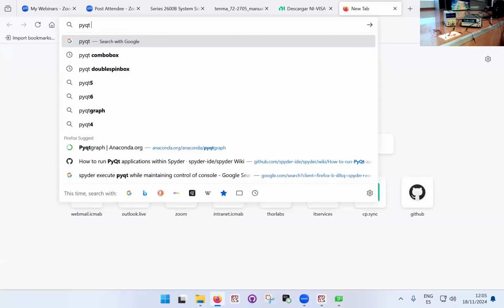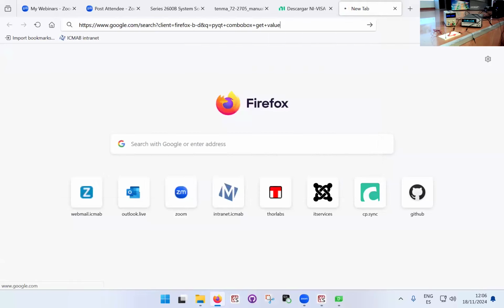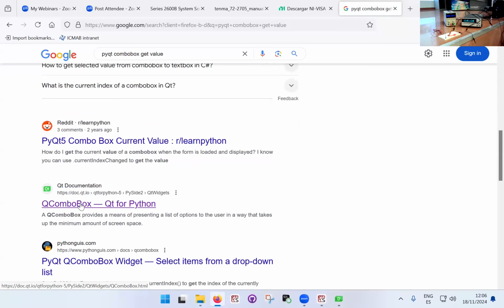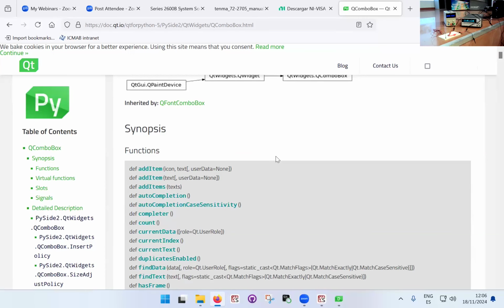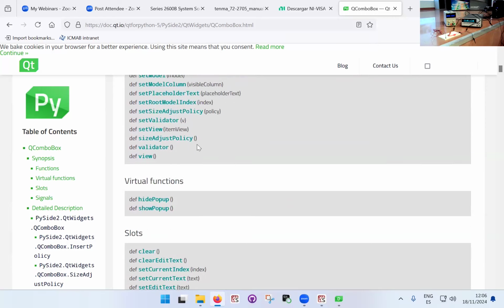I'm going to go for PyQt combo box get value. Okay, generally, there's a PyQt documentation for the combo box itself. This is the sort of the official page for Qt applications. And here you have all the functions that are related to the combo box. So this is already pretty much implemented. So you just have to find the function that you need. And the function that I need is somewhere here.